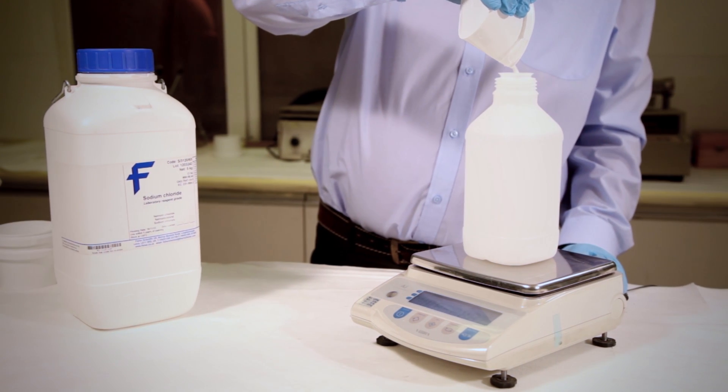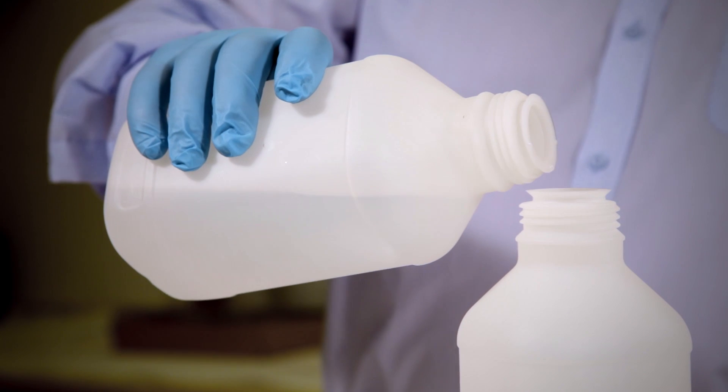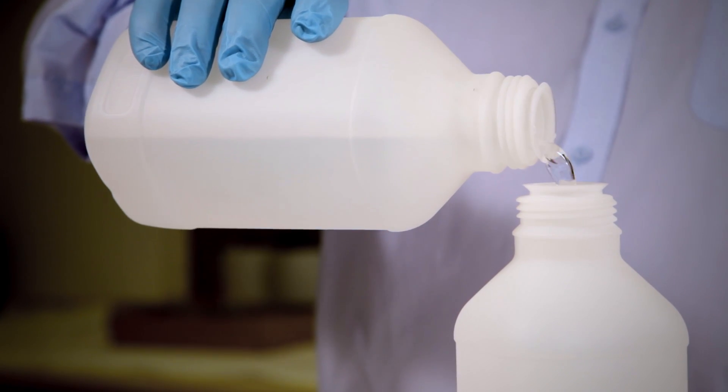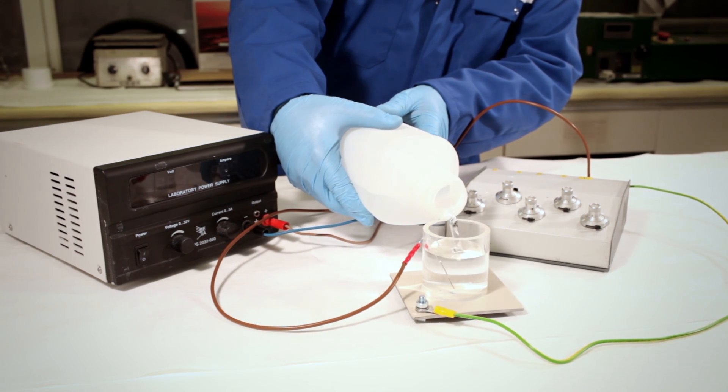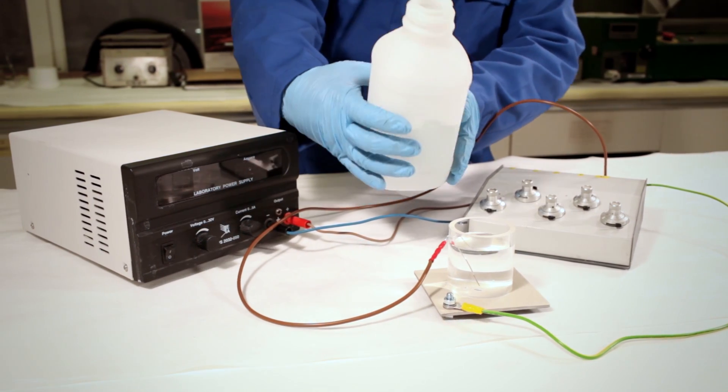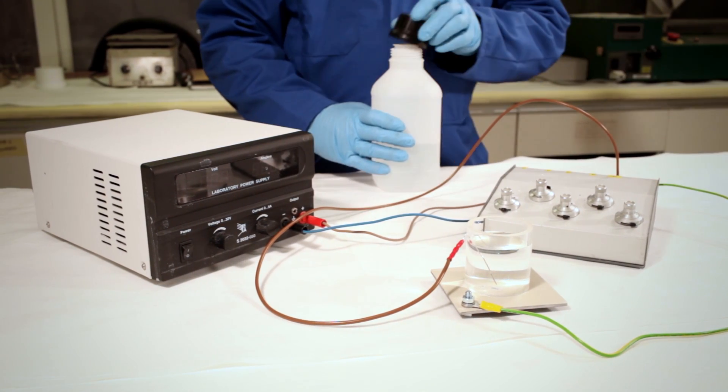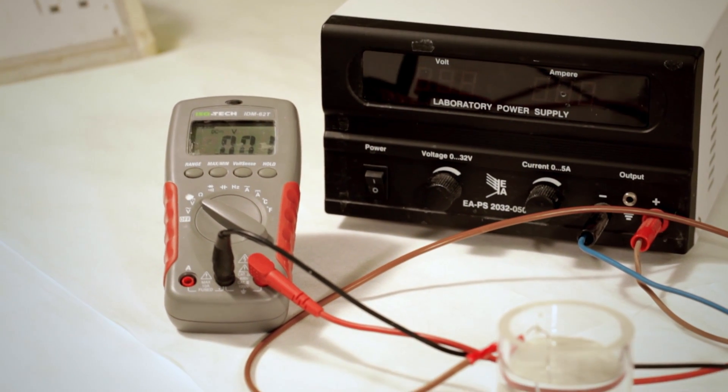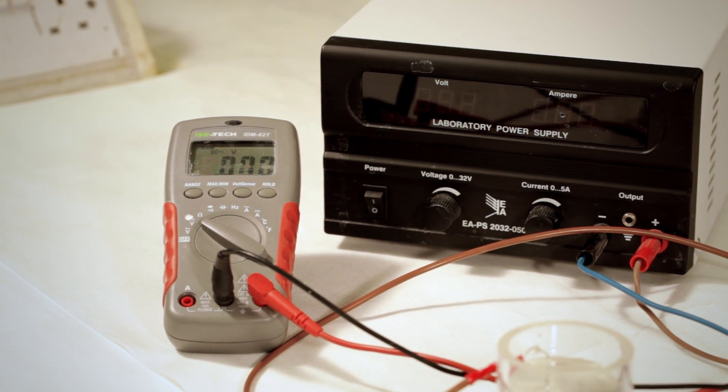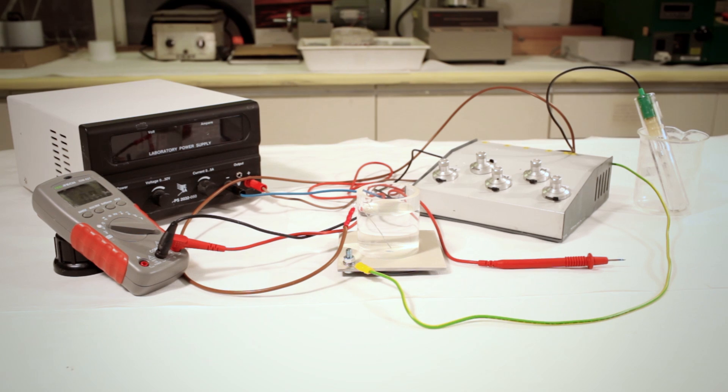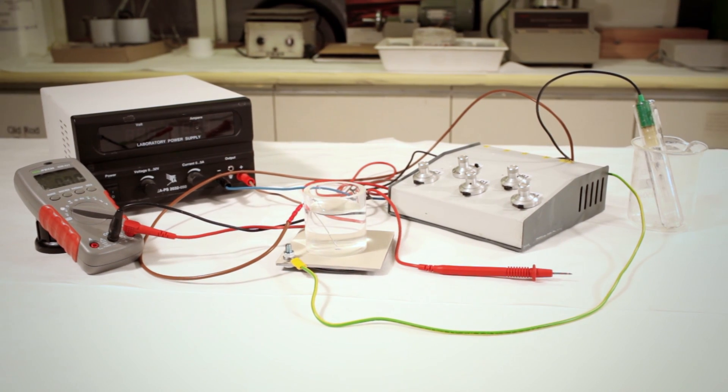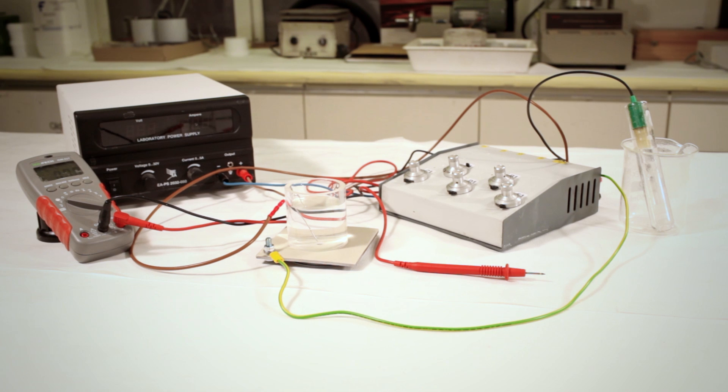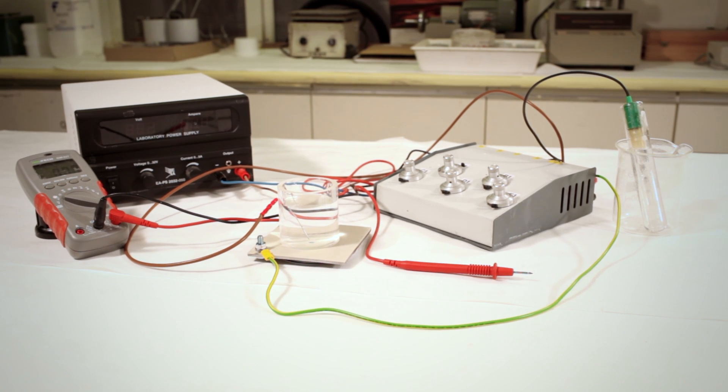An electrolyte solution is prepared by dissolving 30g per litre of sodium chloride in water. The electrolyte solution is used to fill the cup to a depth of approximately 50mm. A voltmeter is used capable of measuring in the range 0-3 volts to the nearest millivolt and a saturated calomel type reference electrode of 12mm diameter with a porous plug.